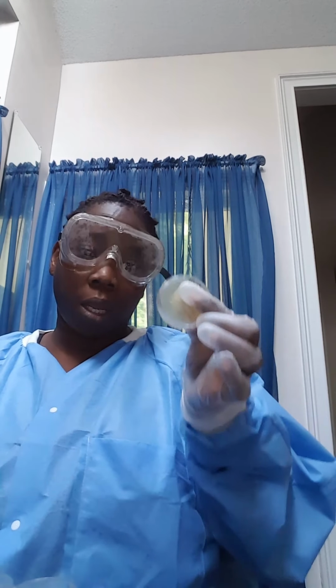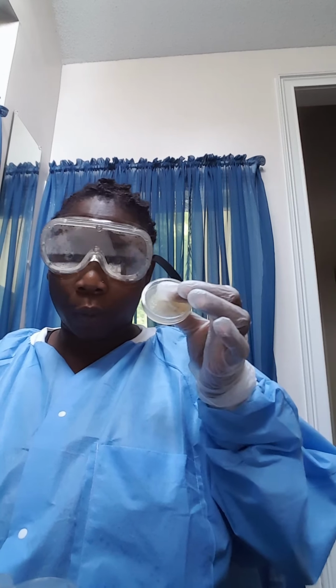Now, the problem that I ran into is that the test tubes were really small, and it was hard to get the solution out, so that I didn't get the 4 drops that I was supposed to get. I kind of had to shake the tube and try to get 4 drops, so they may have gotten more than they were supposed to.